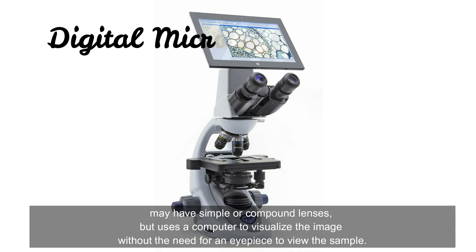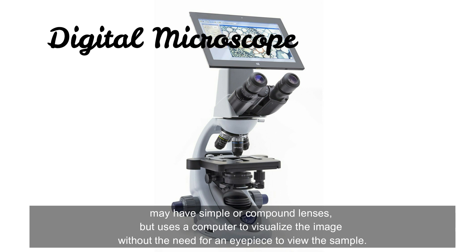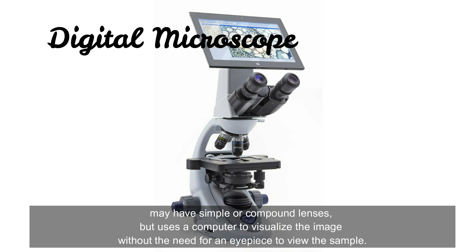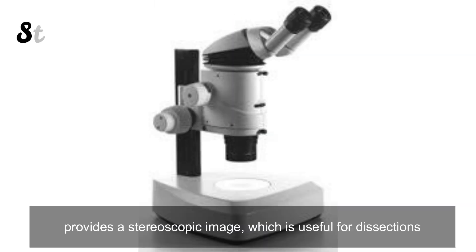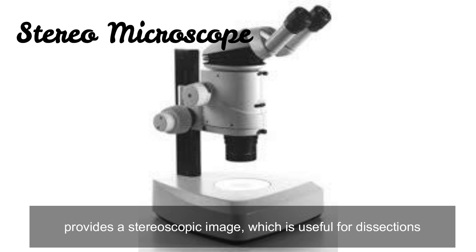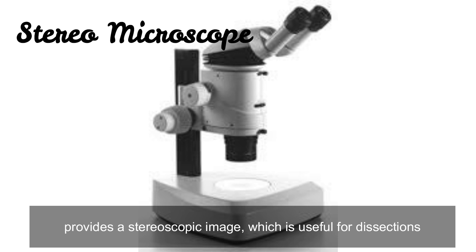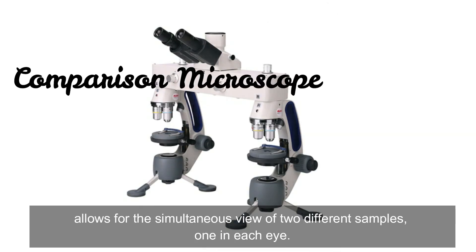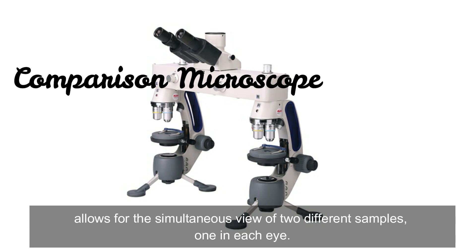Digital microscopes may have simple or compound lenses but use a computer to visualize the image without the need for an eyepiece to view the sample. The stereo microscope provides a stereoscopic image which is useful for dissections. The comparison microscope allows for the simultaneous view of different samples, one in each eye.